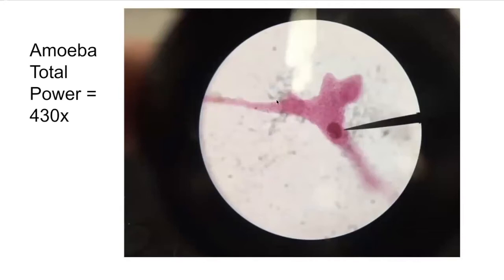And these are called pseudopods, and that's how an amoeba is going to move. It stretches out this pseudopod and latches onto a surface, and then the other side of the amoeba is going to let go of whatever it's holding on to, and it's going to push its cytoplasm toward that pseudopod. And pseudopods are also able to engulf food for the protist.